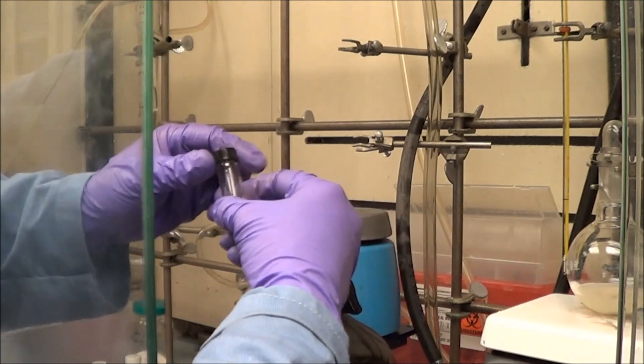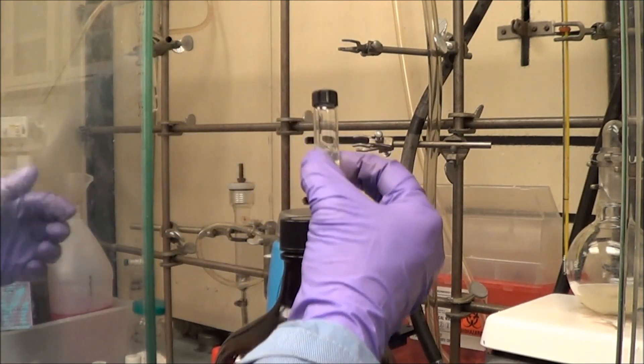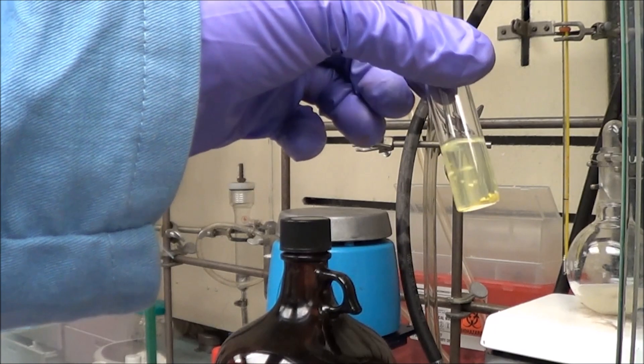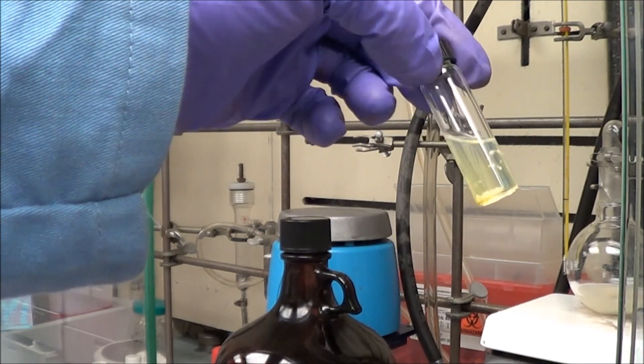So here, the dots have dissolved well in the chloroform, so that's a very good sign. But again, you can see a little bit of a close-up, you can see the polymer is not quite so happy.